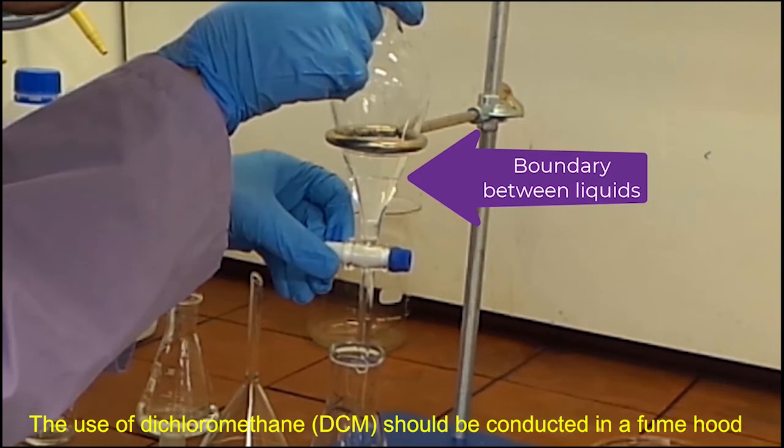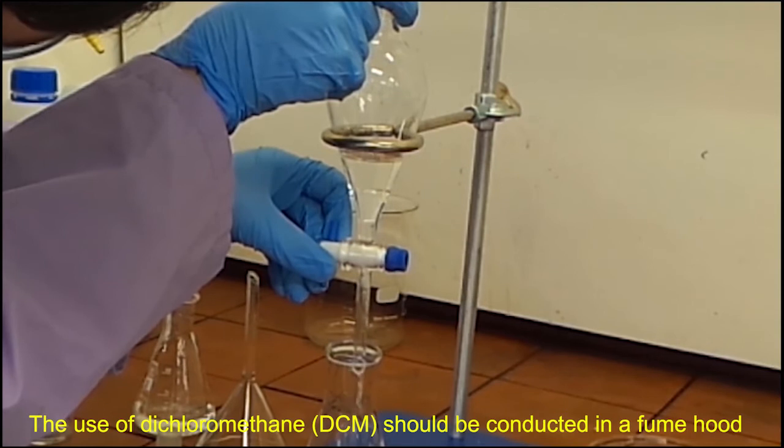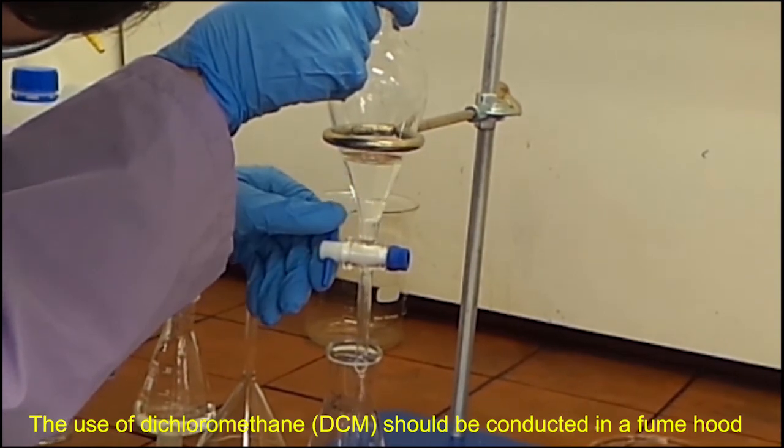Place the collection flask under the funnel and carefully open the valve to let the liquid out, making sure to stop it just before the boundary between the layers so they do not contaminate your product.